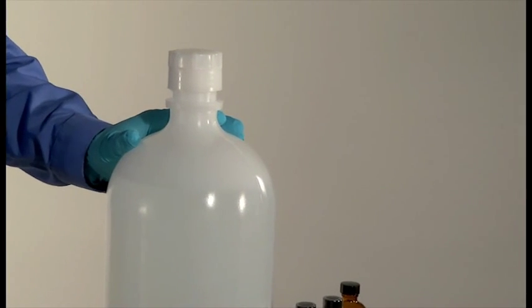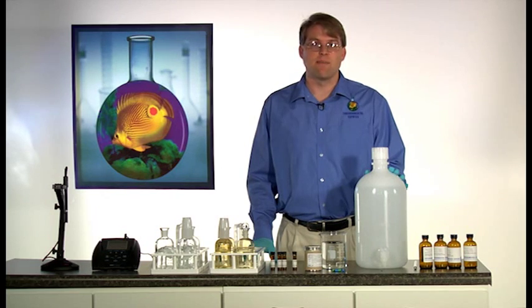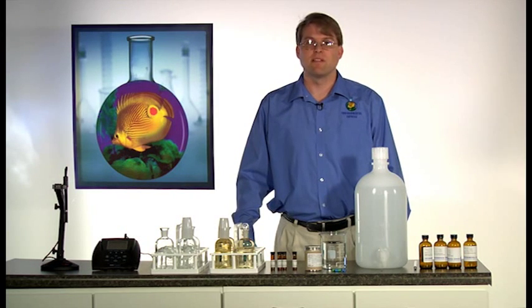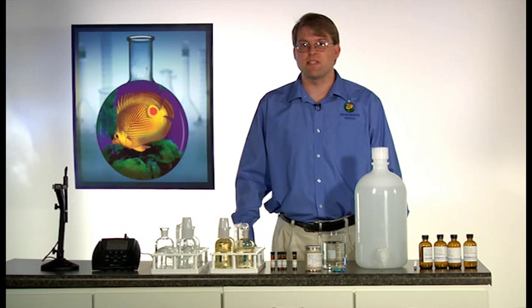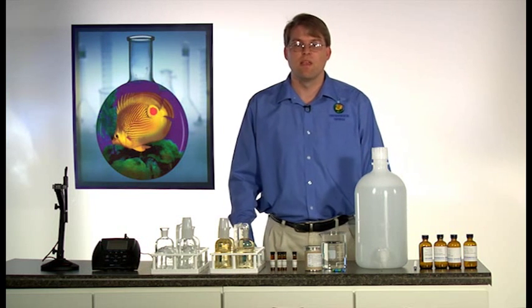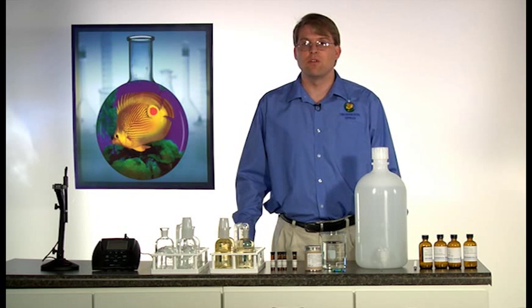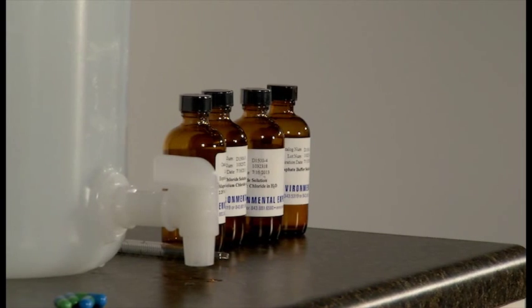Obtaining acceptable dilution water is the first step in doing an acceptable BOD batch. The quality of the dilution water is important because this water will come into contact with every sample involved in your batch. The deionized water requires the addition of several trace nutrients to ensure a proper environment for the incubation of bacterial populations.